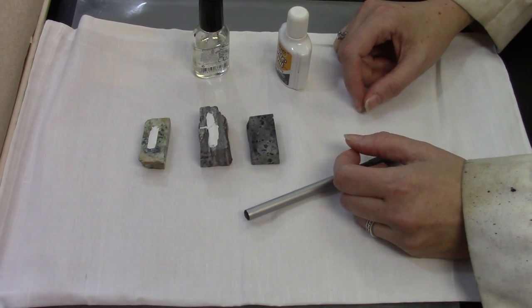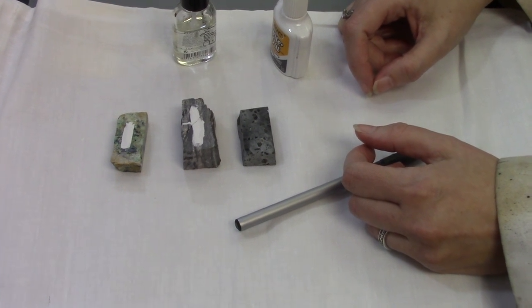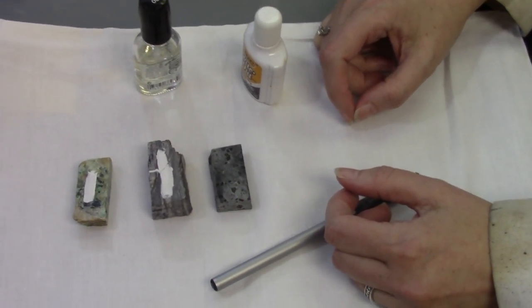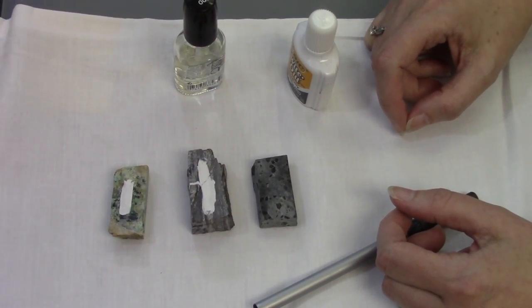In this video, I want to show you how to label your rock blanks. You'll want to put your sample name on rock blanks so you don't get confused about what sample you're making a thin section out of.